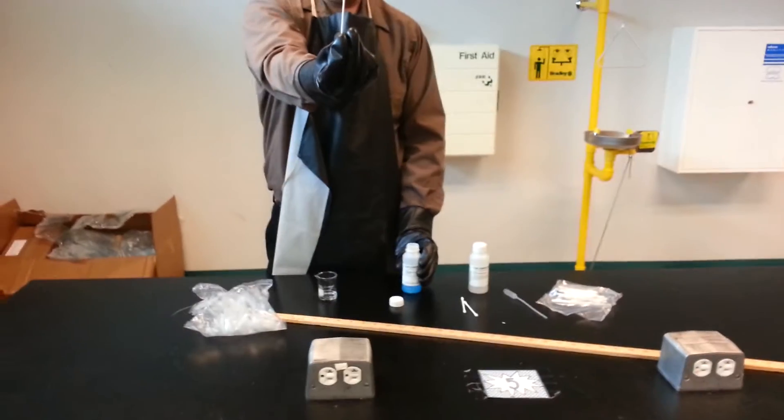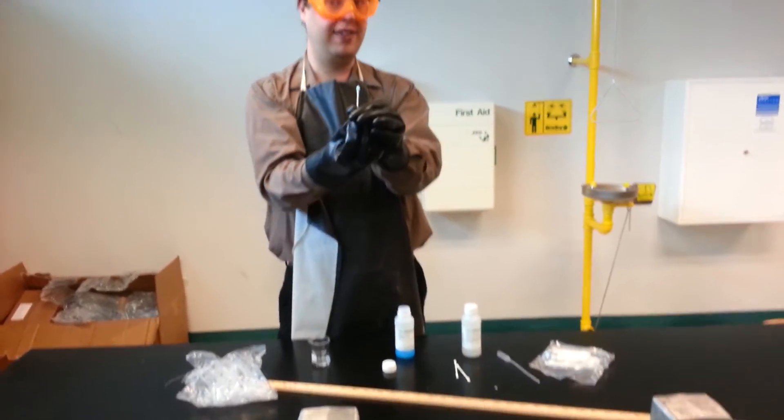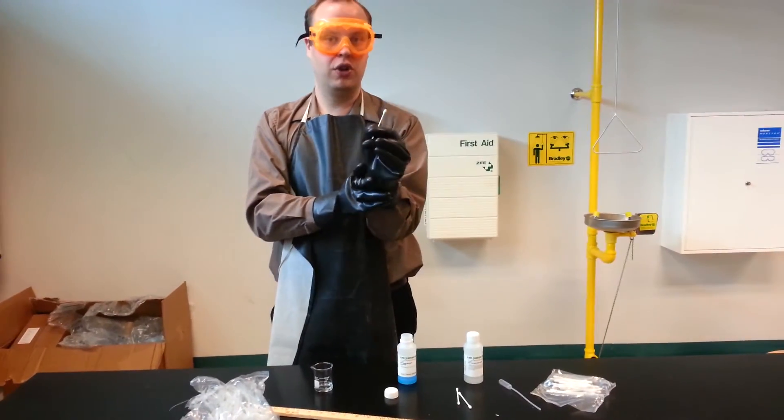Now we're going to place it under sulfuric acid. This is a really strong 18 molar sulfuric acid, and you'll notice a color change.